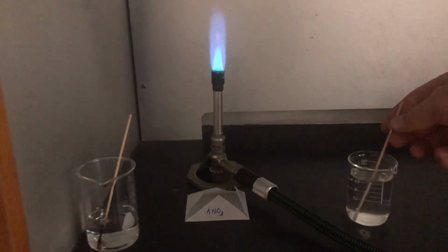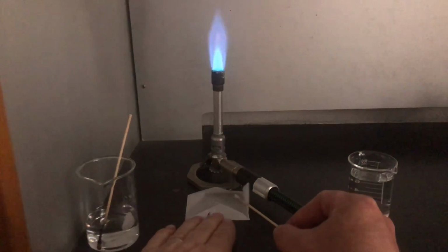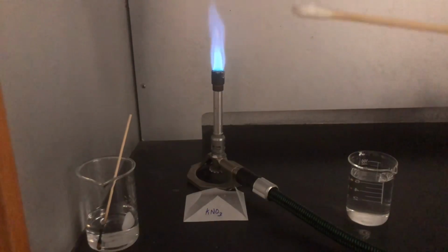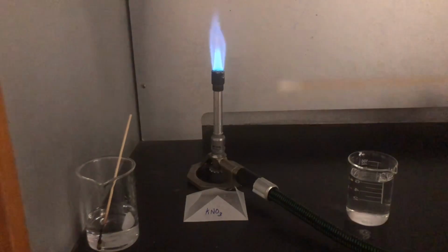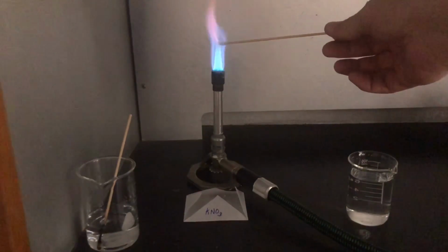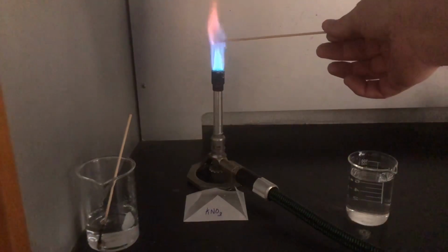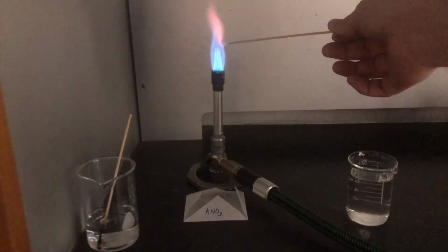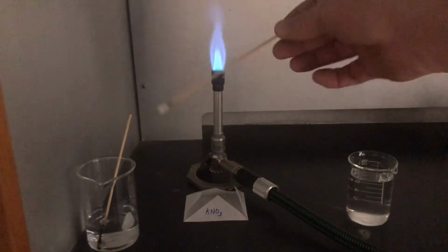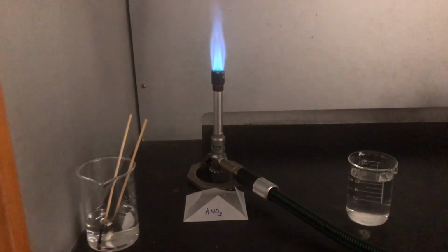So hopefully you have something ready to take down the different colors. We're going to put some potassium nitrate, just a couple of these little specks. It doesn't take very much. We're going to put this into this flame, and maybe you can see that's kind of a lavender color, lavender blue that it burns with. Of course, if it gets into the cotton, it's going to turn a little bit yellow. That is not the color of the potassium nitrate though.